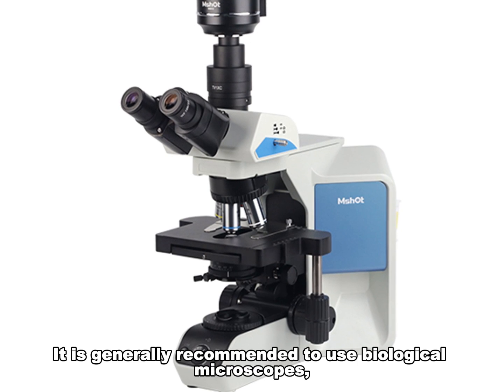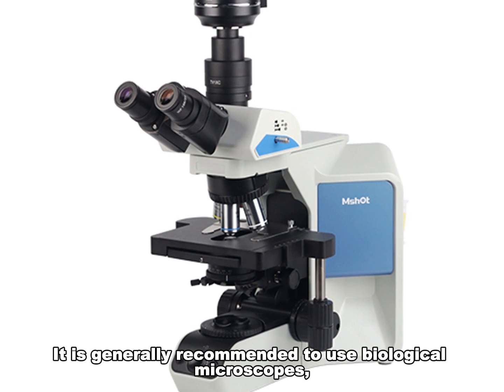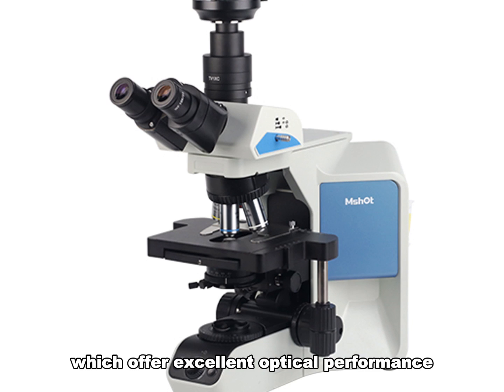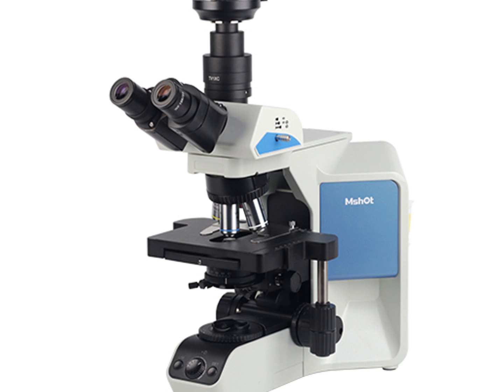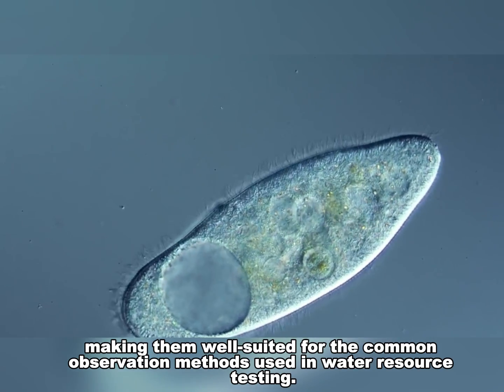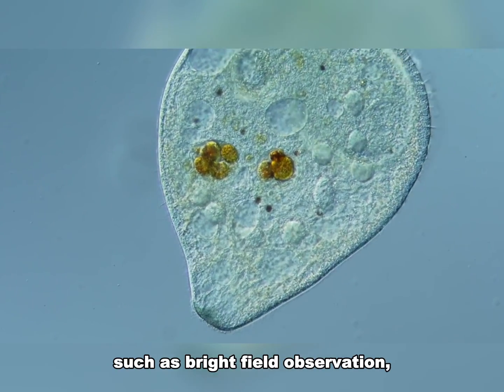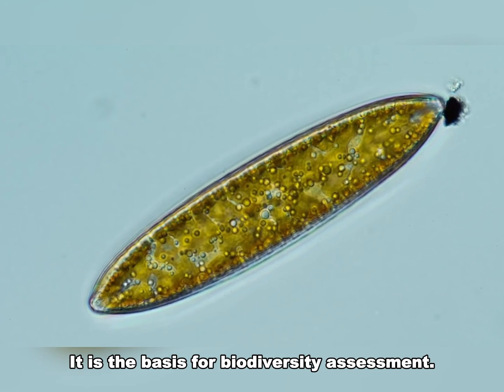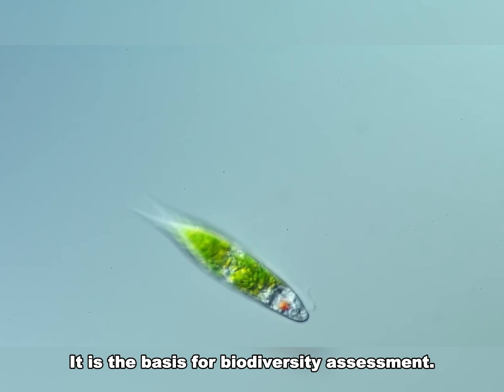It is generally recommended to use biological microscopes, such as MSHOT ML45 and ML51-N, which offer excellent optical performance and strong expandability, making them well suited for the common observation methods used in water resource testing, such as bright field observation, to directly observe algae and plankton in the water. It is the basis for biodiversity assessment.